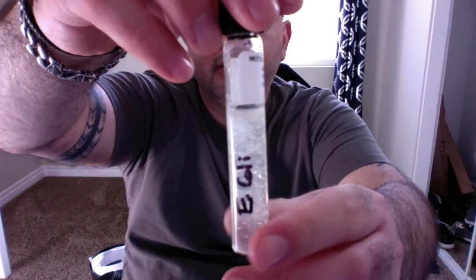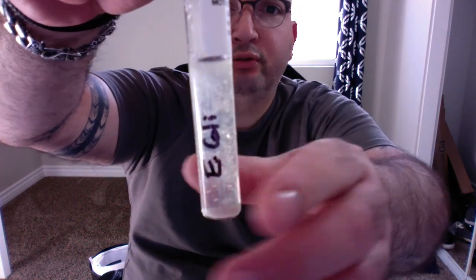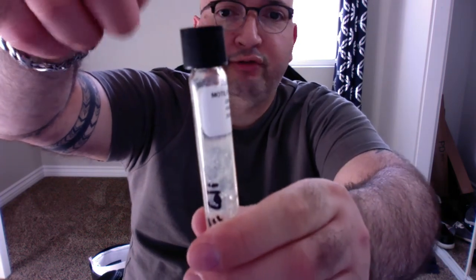So we're going to start with the tube for my E. coli. And as you can see, the consistency of this agar is much different than the agar that I have used in my Petri dishes. So what I did, of course, when I inoculated this, is the lid came off, the paper clip went straight down into the agar and then out in a straight line, just so that I could get what's called the stab line.